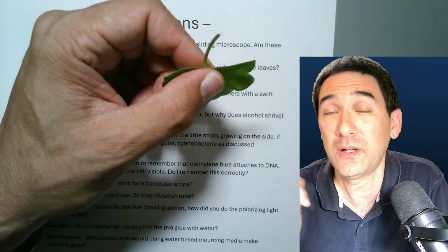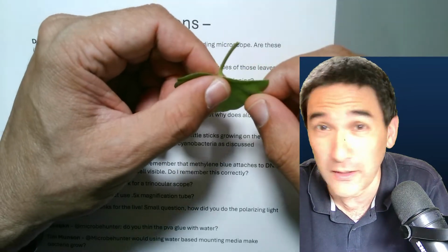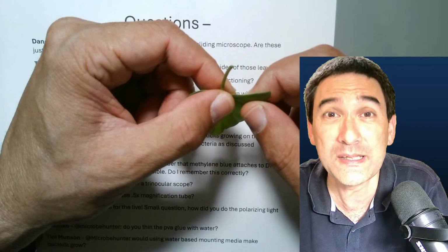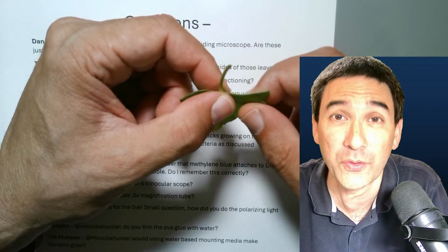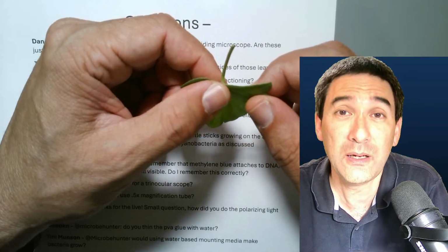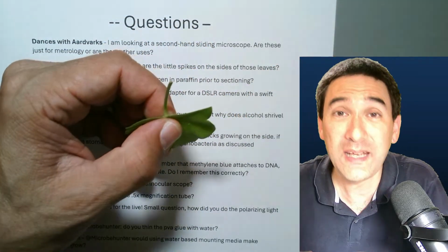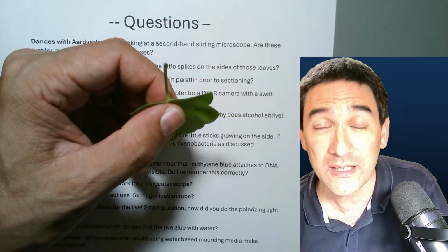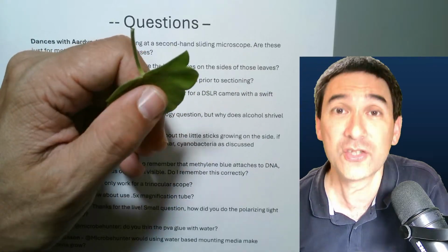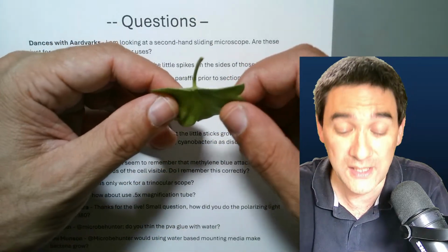Then you have to add a substance. Traditionally, a substance called xylene was used, which is not healthy. You do not want to use this in your household, but especially in hospitals, they are now using alternatives for this, which are less harmful. And then you have to embed it in paraffin as well. Paraffin is wax. And then you have to slice it. You have to section it. Then you have to use xylene or other solvents again to remove the wax, the paraffin. So you see, it's a fairly lengthy process.